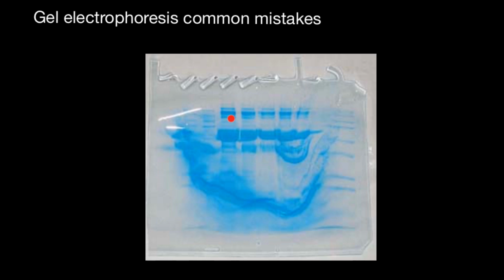What actually happened here, this may happen if someone opens a gel box before the run is completed with the power on. Another thing that can happen is that the user can get killed. So never do it. Of course, modern sophisticated equipment doesn't allow you to do it because it has built-in safety features. But very simple equipment or broken equipment may allow you to do it, and this is what might happen. So again, never do it.